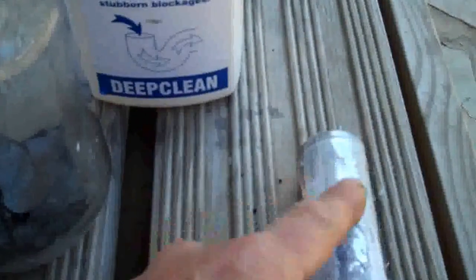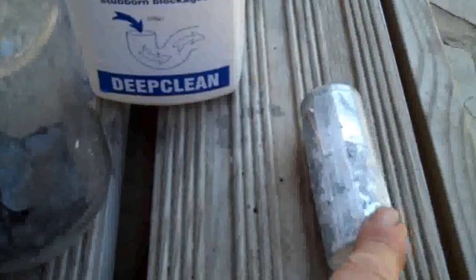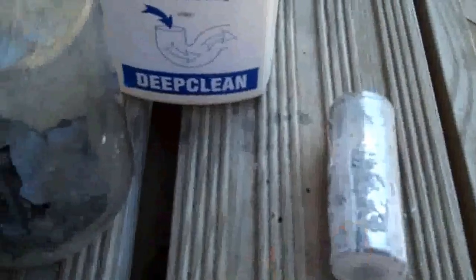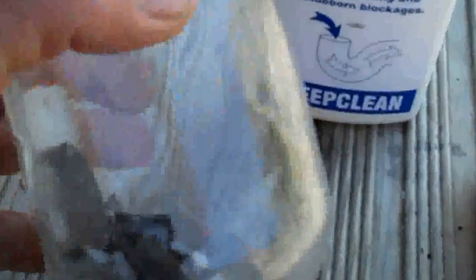That case is pure zinc. What you do is saw a line down there and you'll just be able to peel that zinc off by hand — it's quite thin. I chopped up a couple of them, cleaned them, and popped them into this jar. So what we have in there is some zinc case that I've peeled from some carbon batteries.